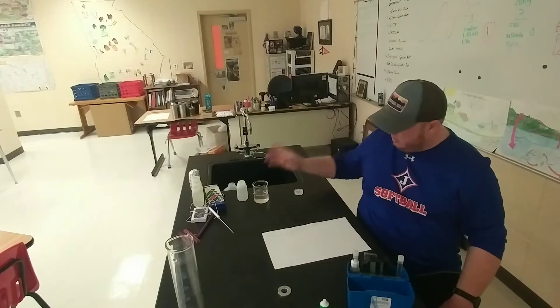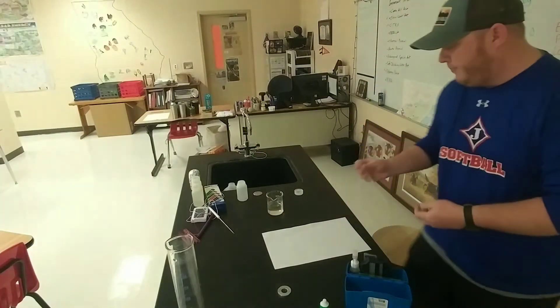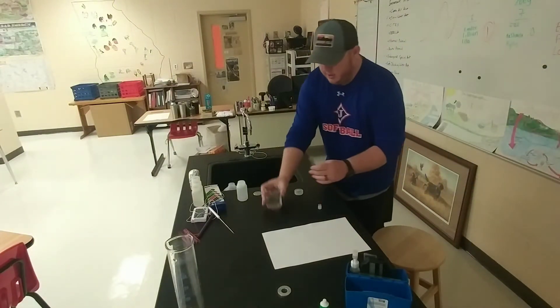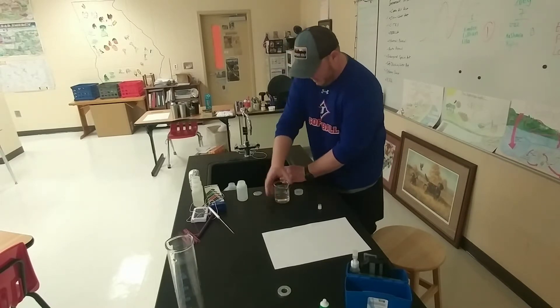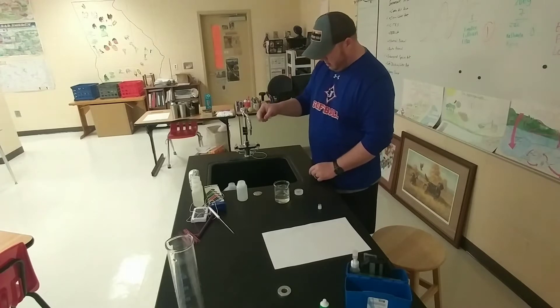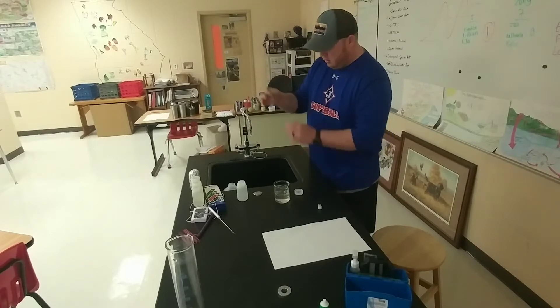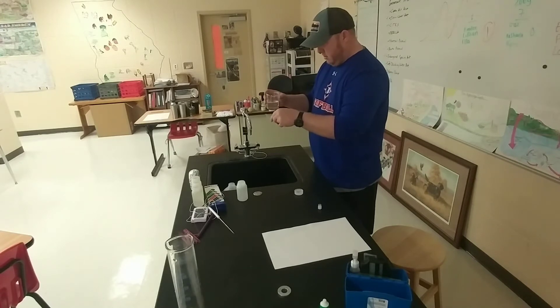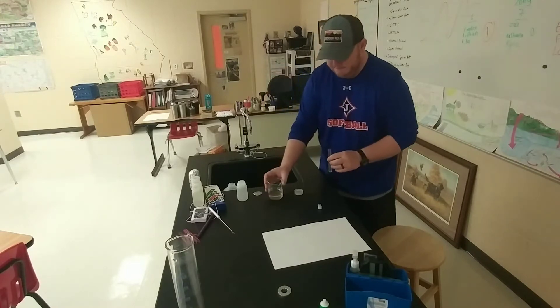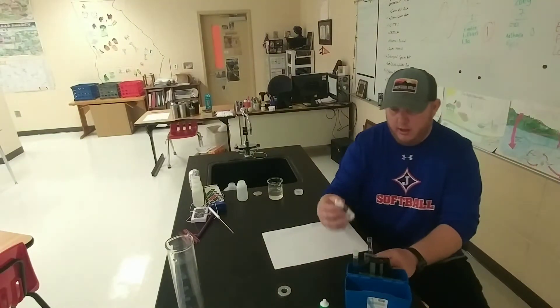This is a pretty easy test. I've poured some sample water into a beaker to make it a little bit easier to pour. I'm going to do that over a sink. You fill up this little tube right here to almost the top — to the 10 milliliter line. That's right on it, 10 milliliters.